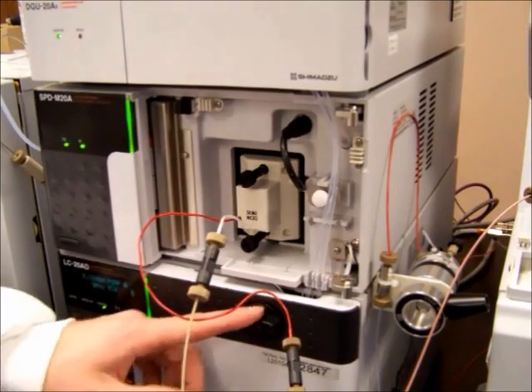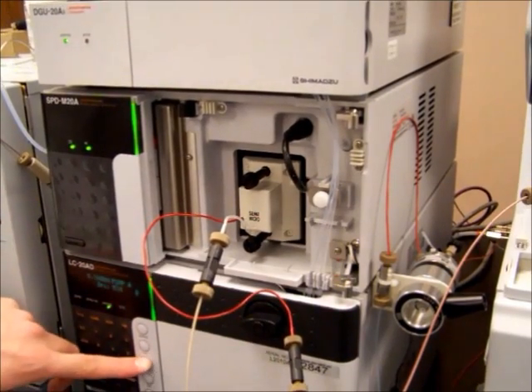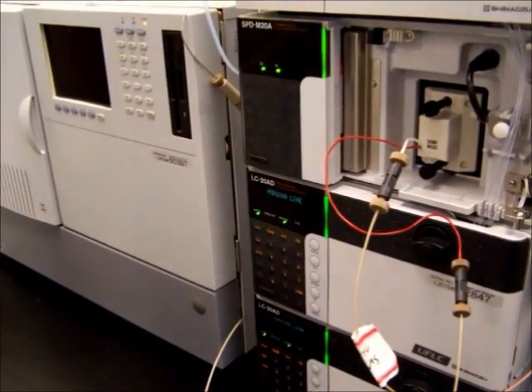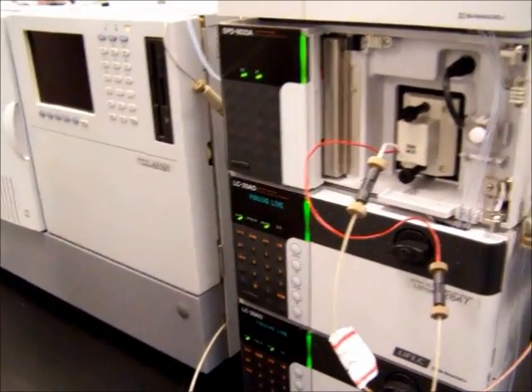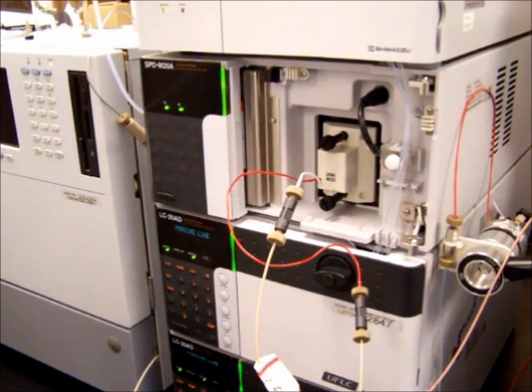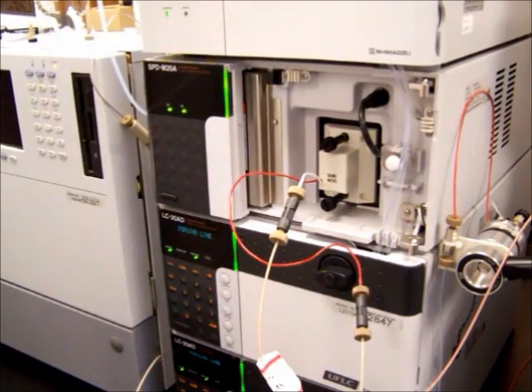Once they've been turned, press the purge button, which is the center button. The purging is important because the purging removes any air within the lines. If there's any air traveling through the lines, it will back up through the instrument and basically the machine won't work.